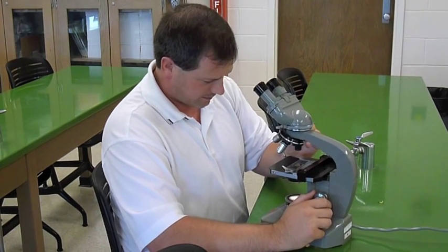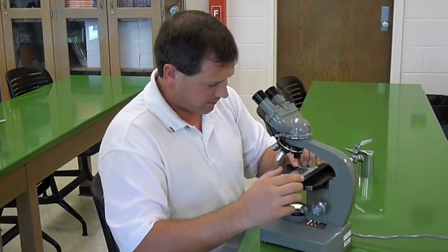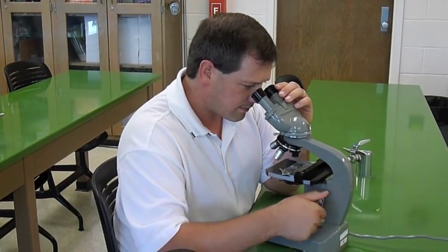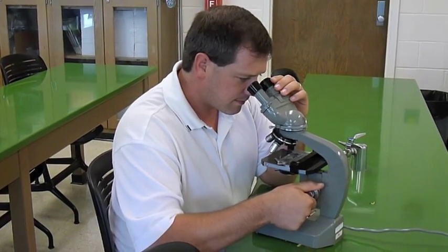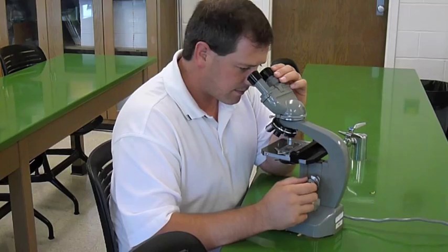To view your slide, place your slide on the microscope using the lowest power lens. Once your slice is in focus on the lowest power, move the objective lens to the next power and focus the leaf once again.